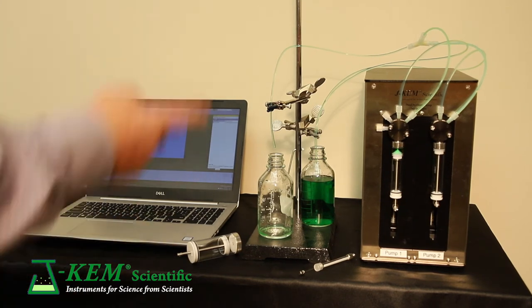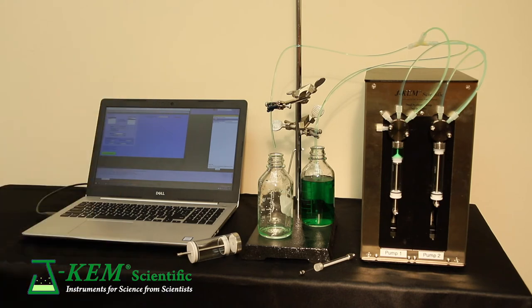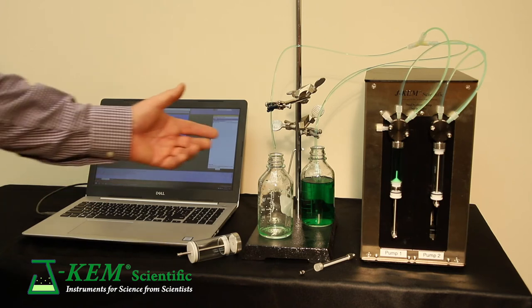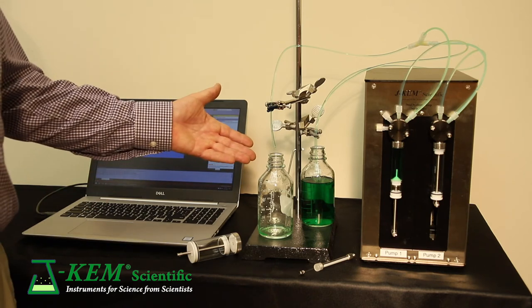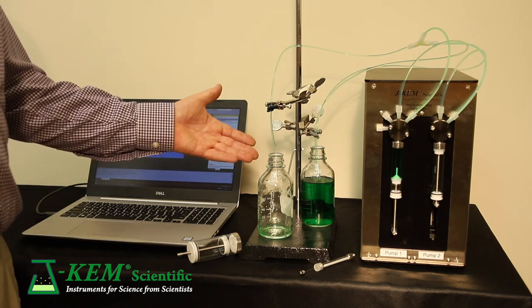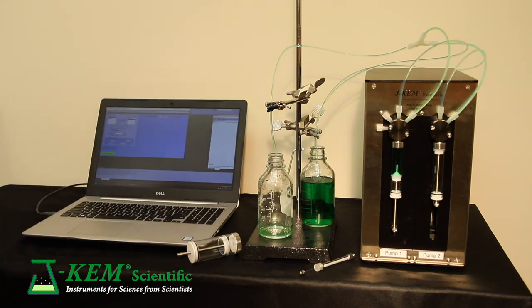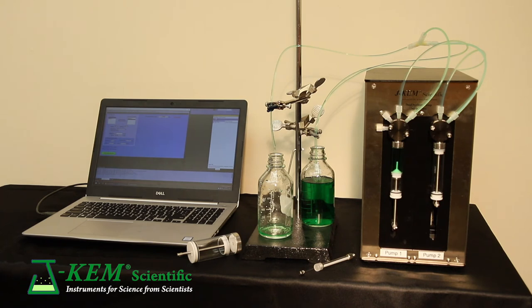The experiment is going to go fairly quick. When I start it, the syringe initially fills, and then once it's full, it will start to deliver. So you can see it's delivering at my requested rate of 25 milliliters a minute. And it'll continue to do that until it's empty.